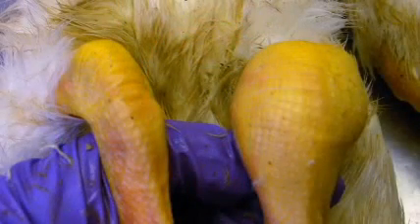Inspect the legs. In commercial or breeder ducks, the intertarsal or hock joint is a common place for arthritis and tenosynovitis to develop. This can be recognized as swelling in the hock region. Inspect the feet. The foot pads, webs, and toe joints should all be examined closely for the presence of swelling, wounds, or other lesions.